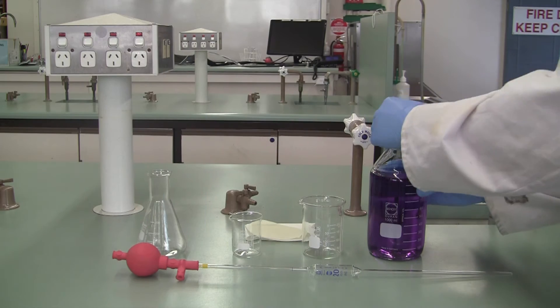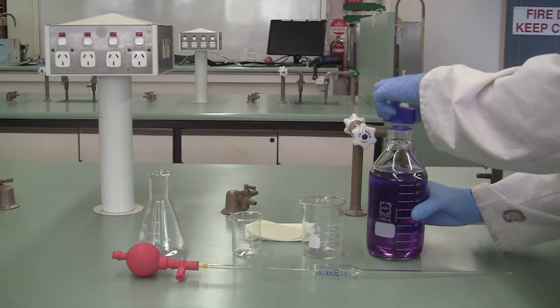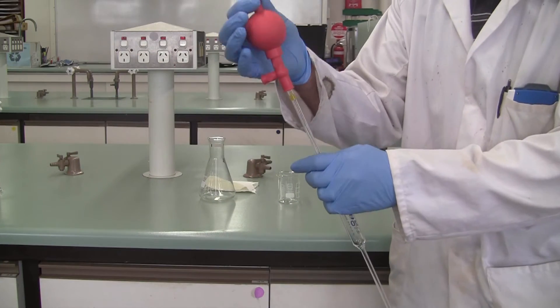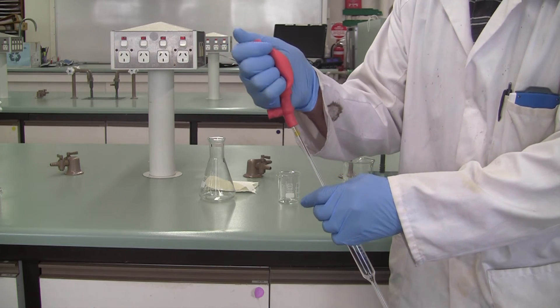So now that we've got it assembled, you can then collect some of your sample and pour it into a clean, dry beaker in order to avoid contamination.